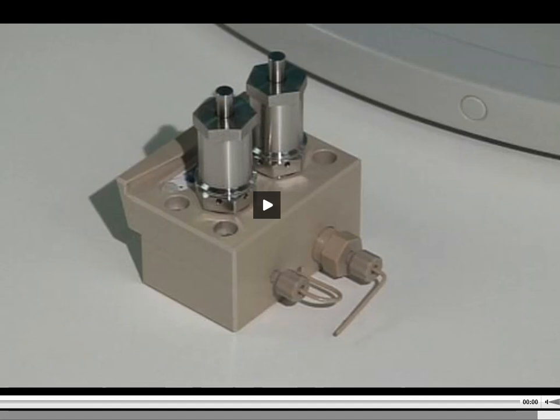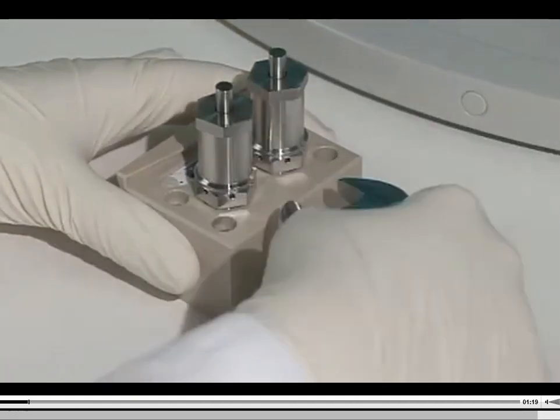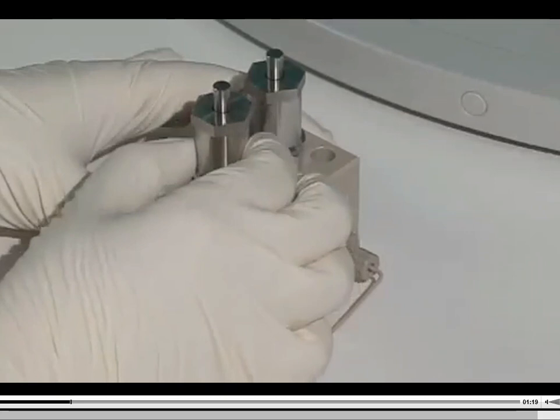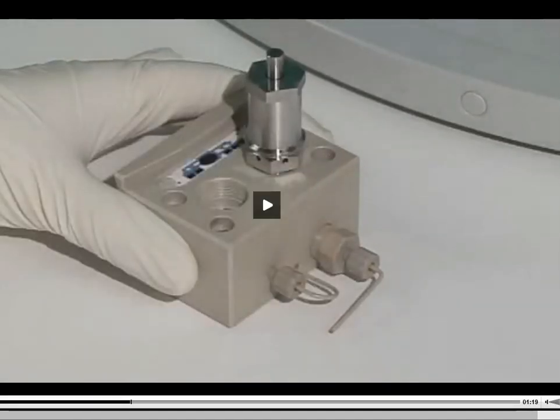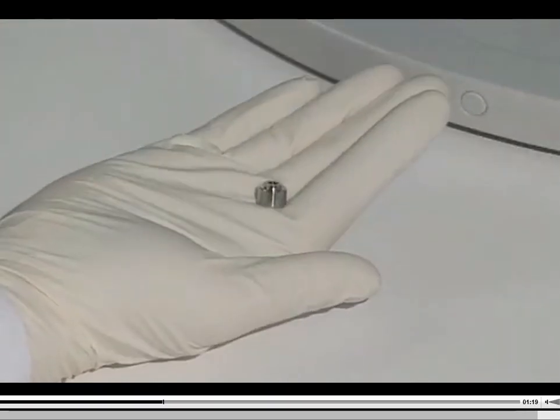So in this video, the person's going to first take the wrench and loosen up these pistons, and you're going to have to be very careful with that because you can easily scratch them and you can easily break them as well. So they're going to unscrew the first one and it just kind of pops out of there. No big deal. Clean that off with methanol if you have to, or isopropyl alcohol. And I don't think in the video they're going to do this, but you can also take this one off as well in the same fashion. No big issue. They're both made the same. And you can clean that one off too at the same time. The next thing that they're going to do is go through and kind of pop out that holder.